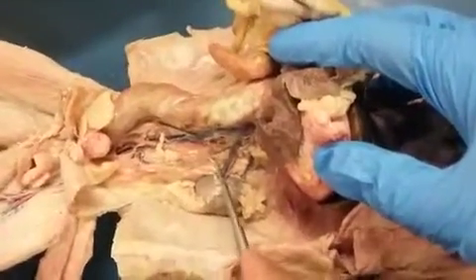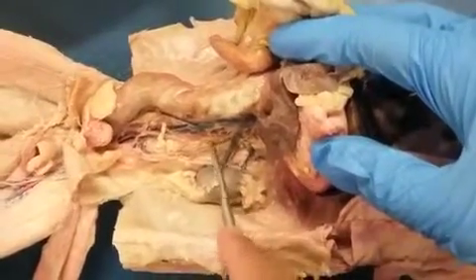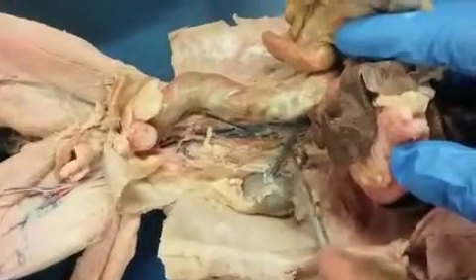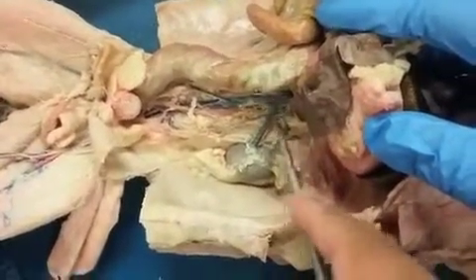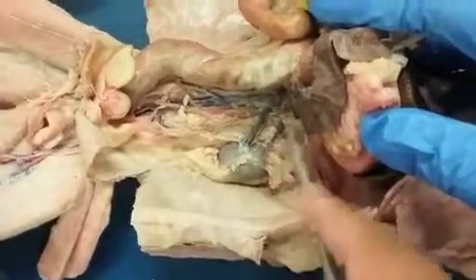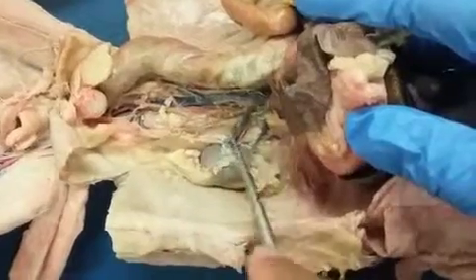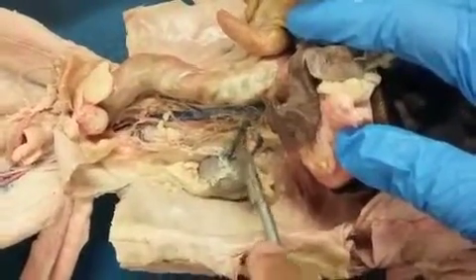Here on the left side though, it's a little bit different. Right, the left gonadal, in this case the left spermatic, instead of draining into the vena cava, will actually drain into the left renal first. Right? And then the renal vein then drains into the inferior vena cava. Right? And so again, here's the right one, draining there. And here's the left one, draining here.